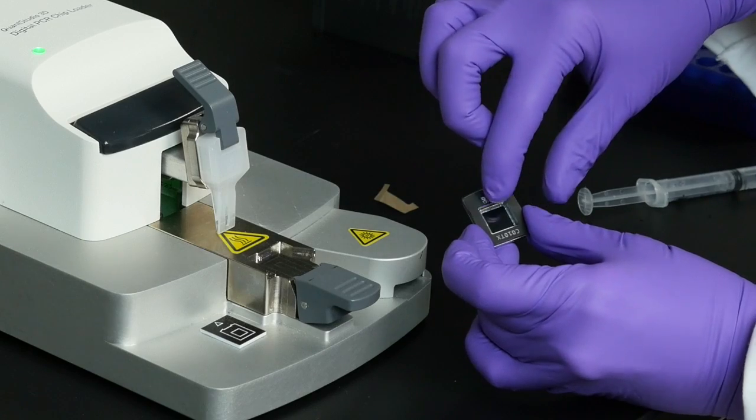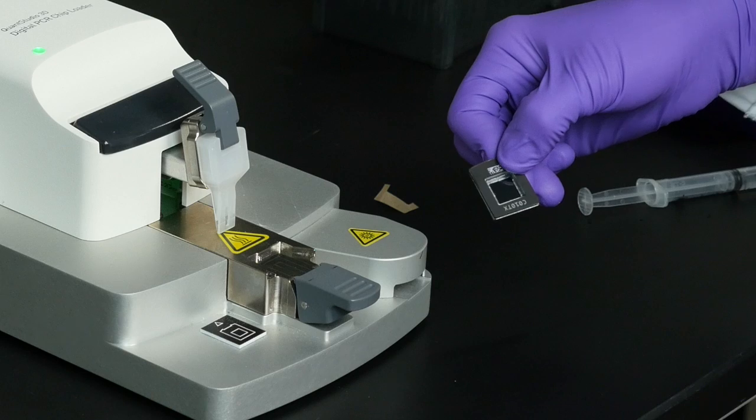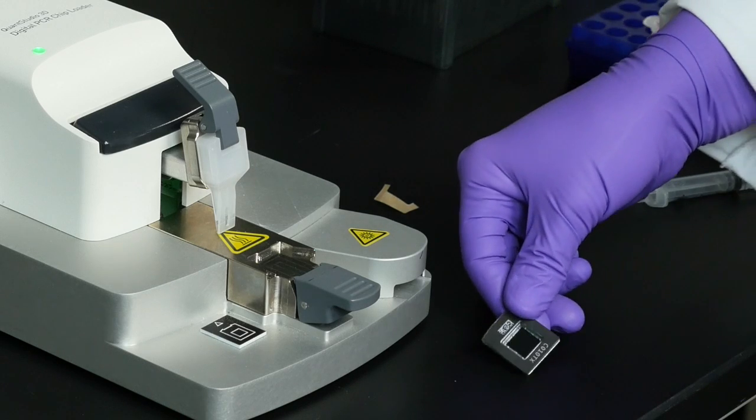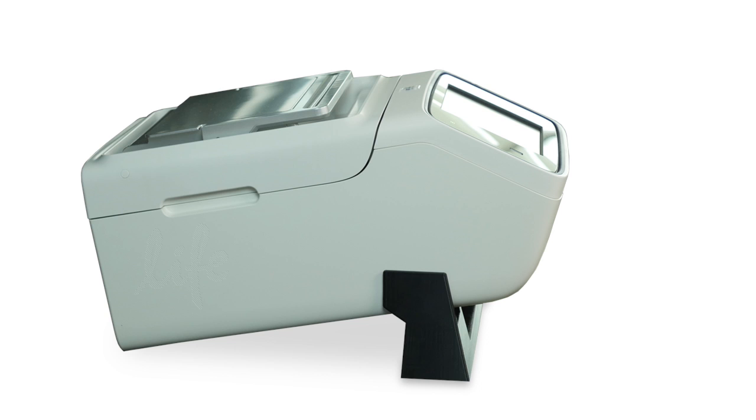Gently run your finger across the top of the label, then hold your thumb over the fill port for 5 seconds. Your chip is now sealed and ready for amplification on a dual flat block thermal cycler.